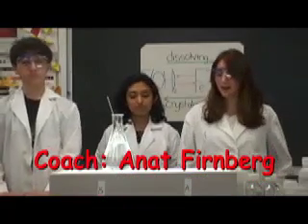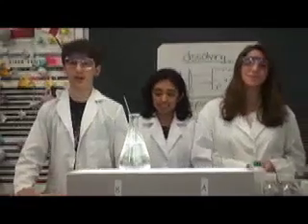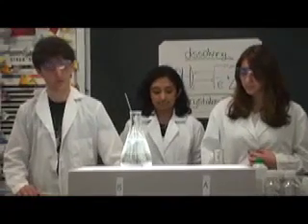And this is our solubility and equilibrium demonstration. We'll be forming the precipitate iron hydroxide by the reaction of iron 2 chloride and sodium hydroxide, and then reversing the equilibrium established with an acid. Throughout this demonstration, we will be illustrating the concept of solubility and equilibrium, as well as Le Chatelier's principle.